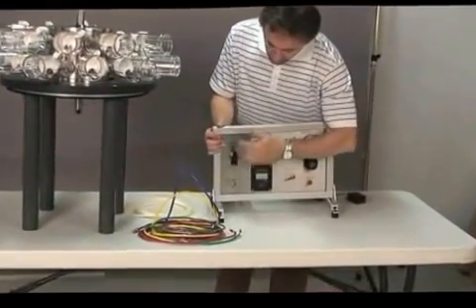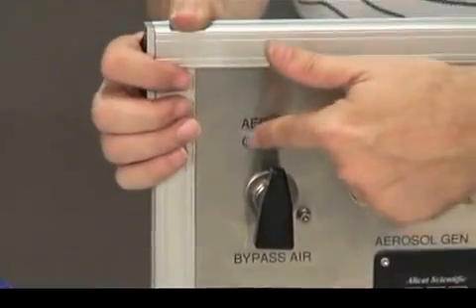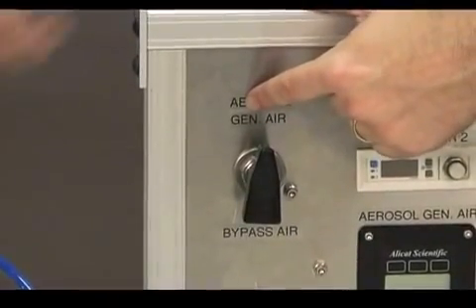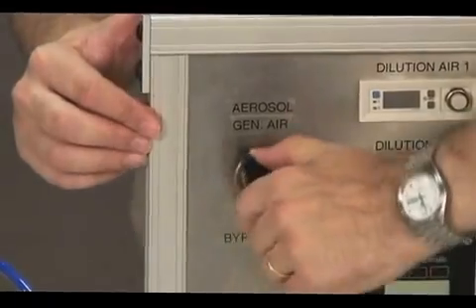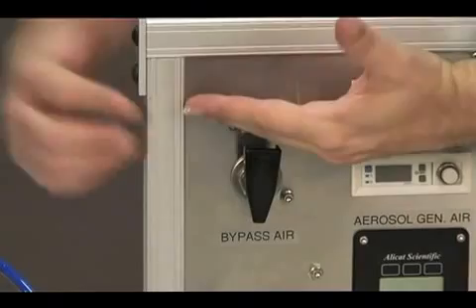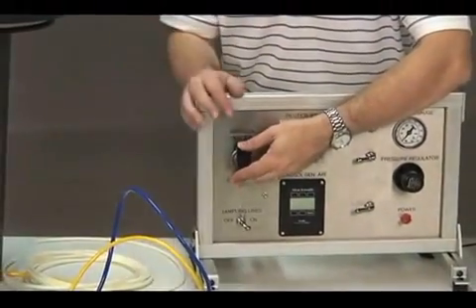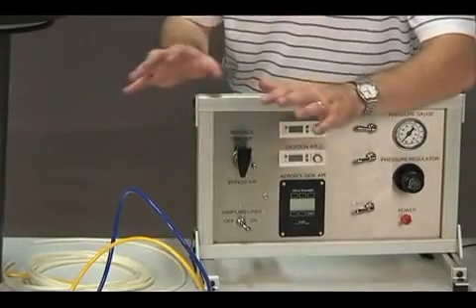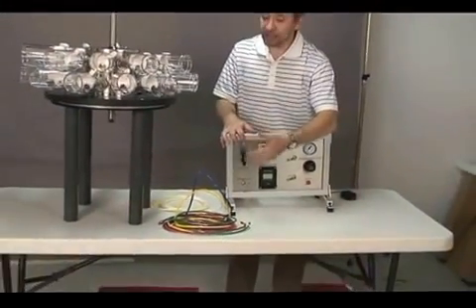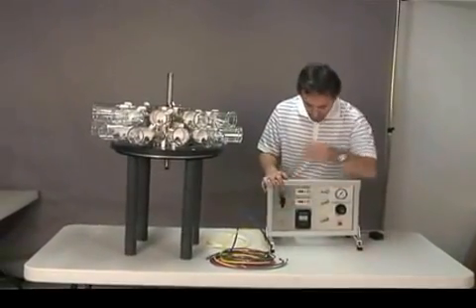By selecting which way the valve is positioned, we can either supply the aerosol generator, which means we are supplying the system with fresh test atmosphere, or if the switch is down, we are cutting off the air supply to the aerosol generator and just supplying clean, breathable air to the animals. This is the position where the exposure always starts and ends. It's also the position when we quickly need to cut off the aerosol generation.